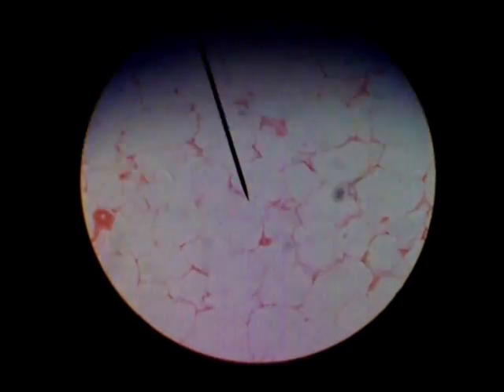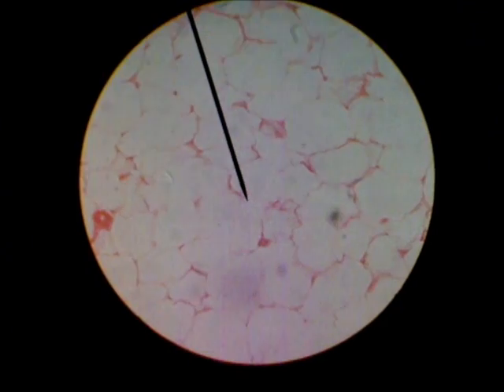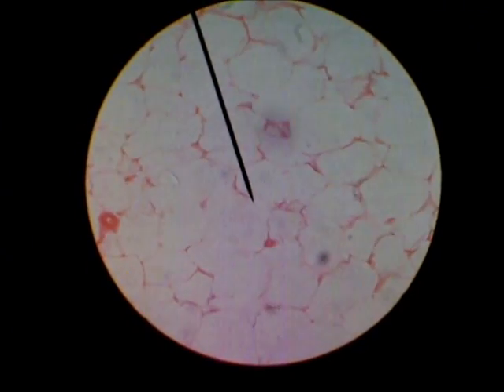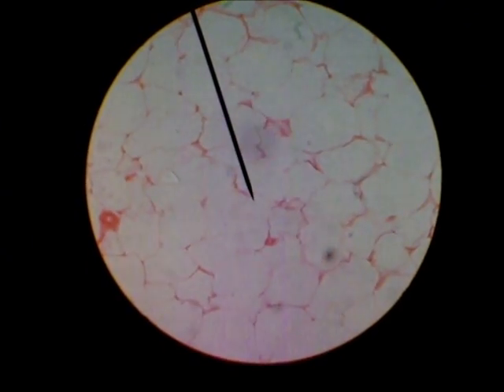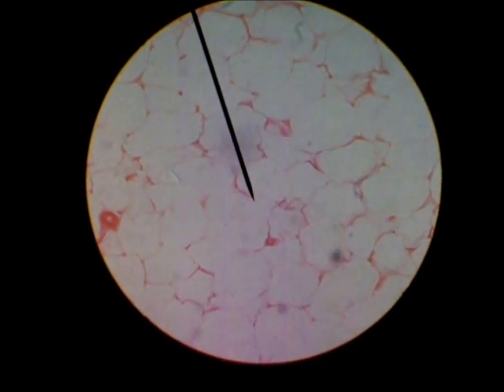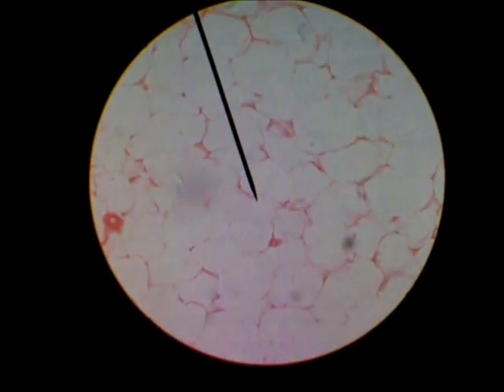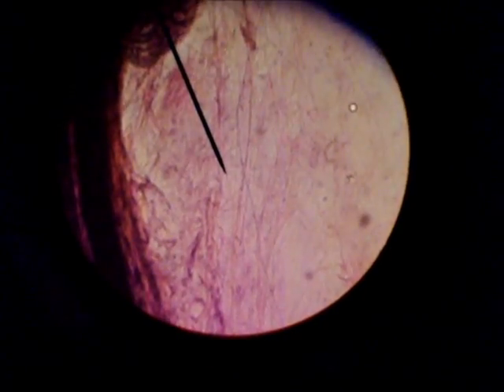This is adipose connective tissue. The nucleus is crammed on the outside of the cell.